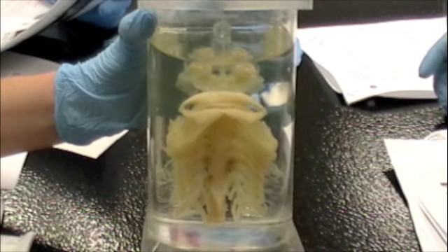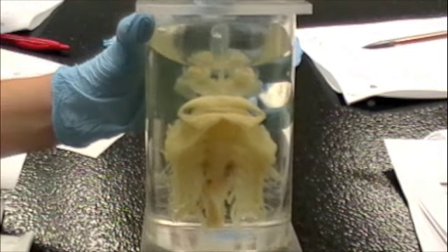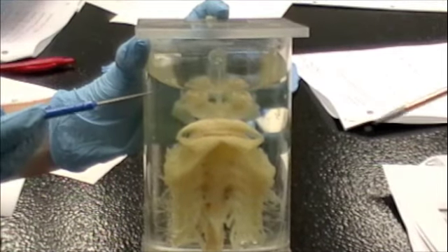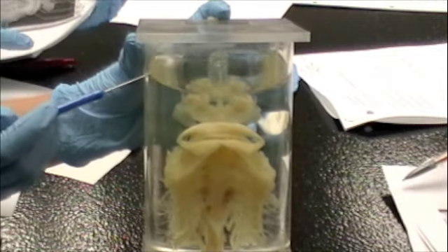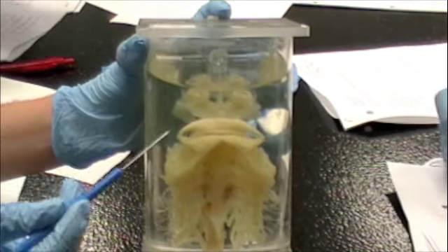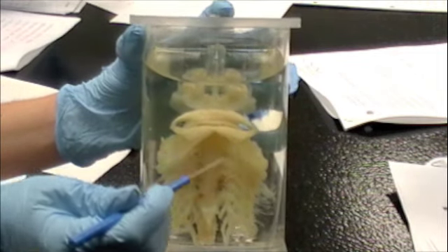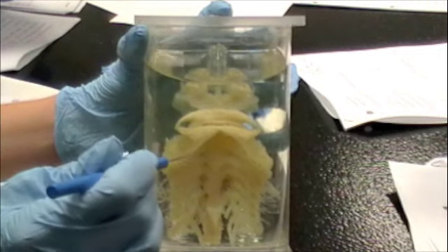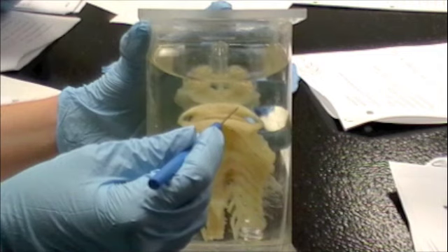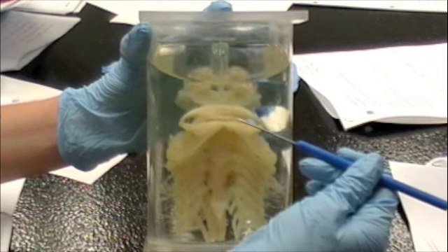This is the ventral view of the splanchnocranium. Once again the rostrum — that's the very top. Nasal capsule. Hyoid arch is this thing, right? The mandibular arch is the top arch and the hyoid arch is the bottom one. The mandibular arch consists of two things: the top one is the palatoquadrate and the bottom is Meckel's cartilage.